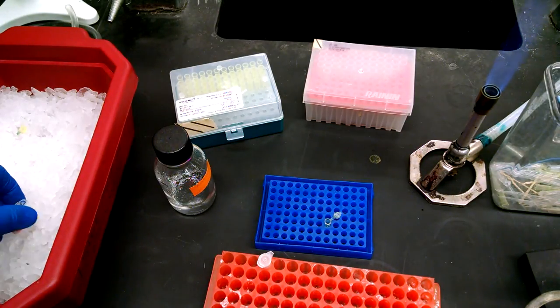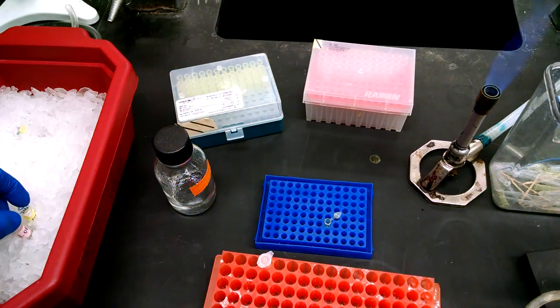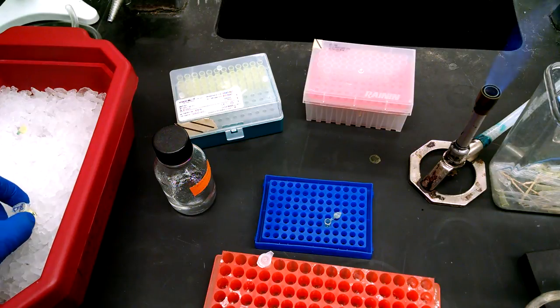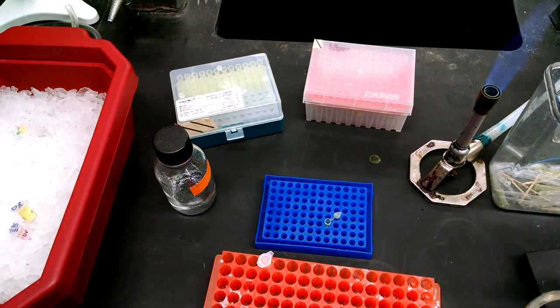Well, there are two primers, the RPSL up and RPSL down, but really whatever two primers you're using for your colony PCR. In this case, RPSL up and RPSL down and our template DNA. And so we're going to use a P10.